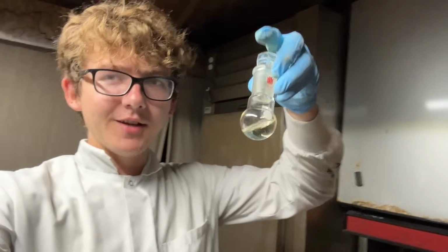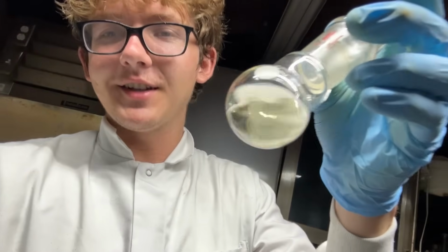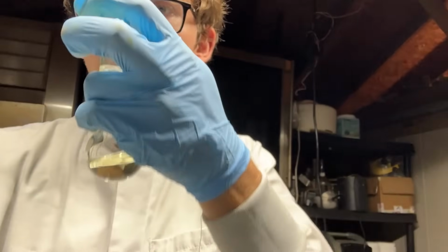So here it is, the moment of truth. It's time to smell our isovaleric acid, aka the smell of foot odor. So yeah, I caught some earlier whiffs of it, very light. So let's get a full-blown sniff test of the pure compound. So this is going to be interesting. So let's pop our cap off here, and let's give it a whiff.